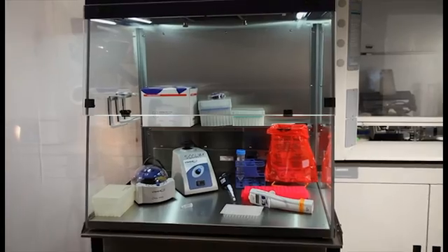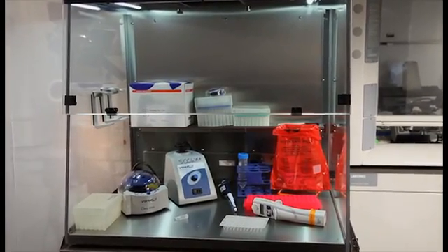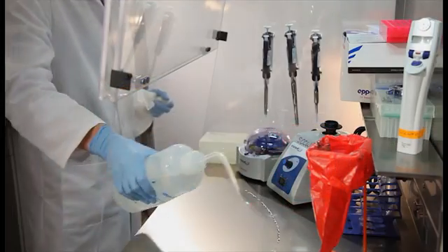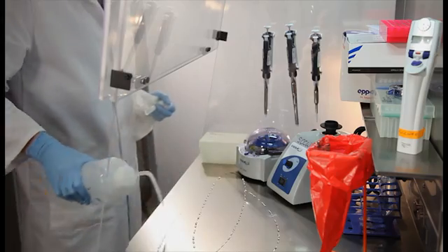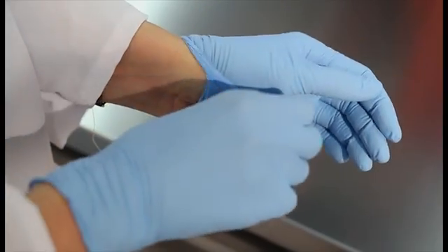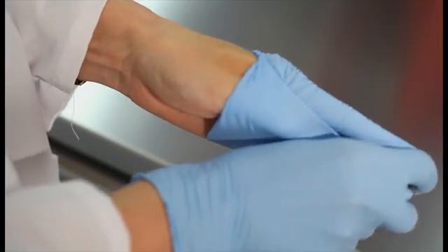The next step is to prepare the qPCR mastermixes in a dedicated PCR hood. Prepare the hood by wiping the surface with a 10% bleach solution. When finished, change gloves.